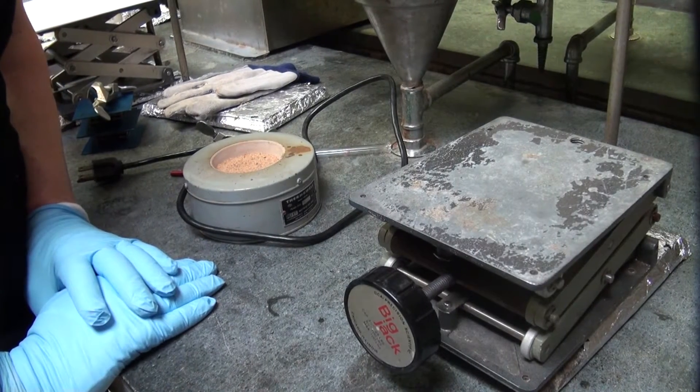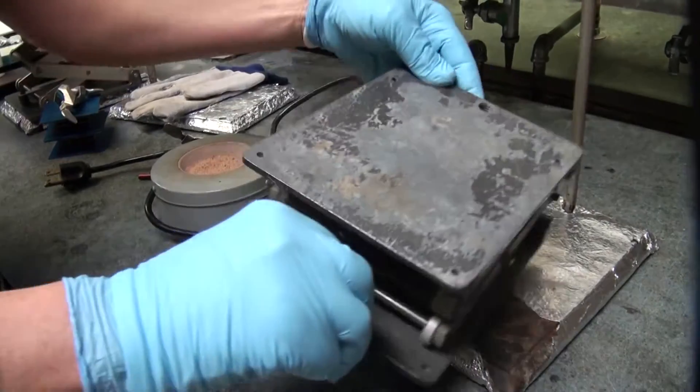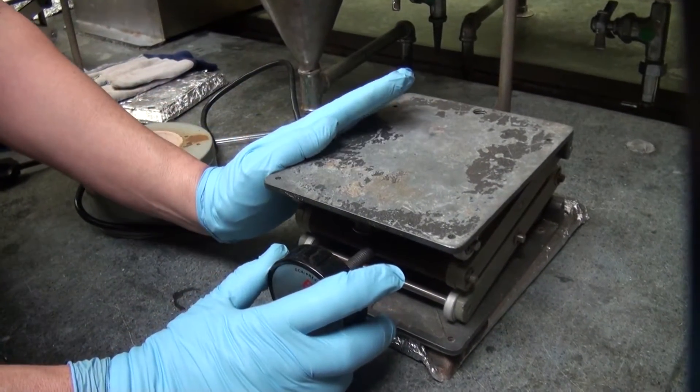Setup of a micro scale reflux apparatus. You need a stand, you need a jack because you want to heat something and every time when you want to heat something you need a jack.